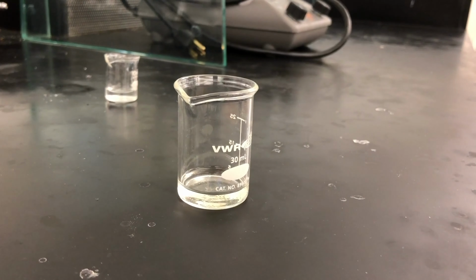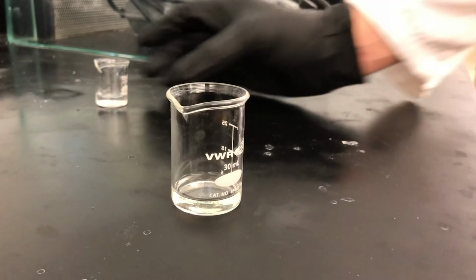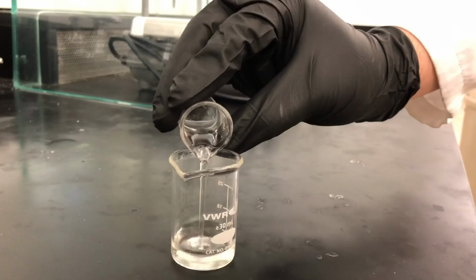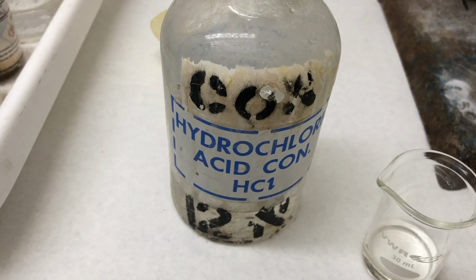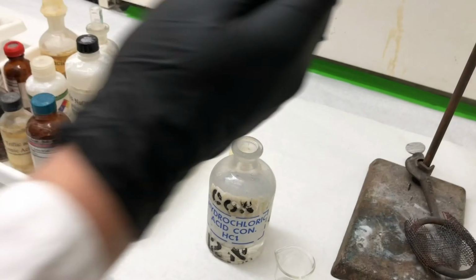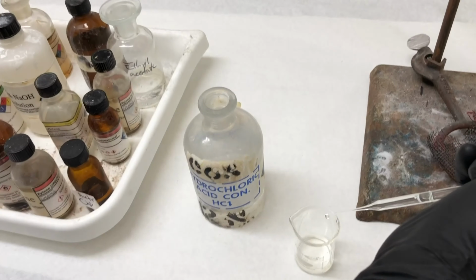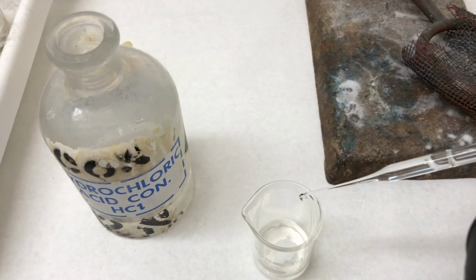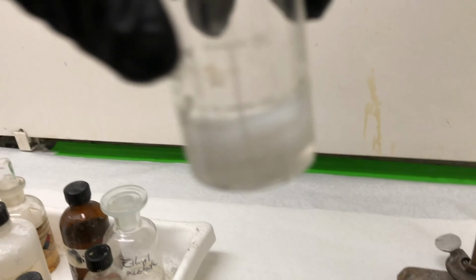Now we'll move on to isolating the acid from the aqueous layer. We'll begin by adding some distilled water to dilute the solution. Now we're going to add concentrated hydrochloric acid. Remember to carefully handle the solution with gloves and in the ventilation hood. The acid will free the 4-chlorobenzoic acid from the potassium ion, resulting in a slurry of the carboxylic acid in water. If the slurry dissolves, that means you need to add more acid.